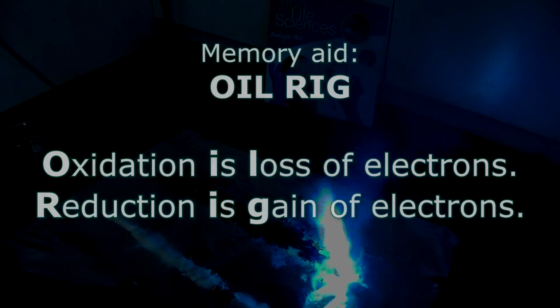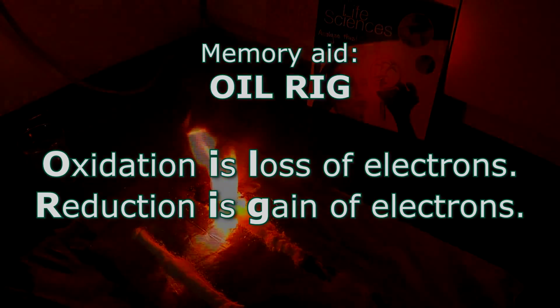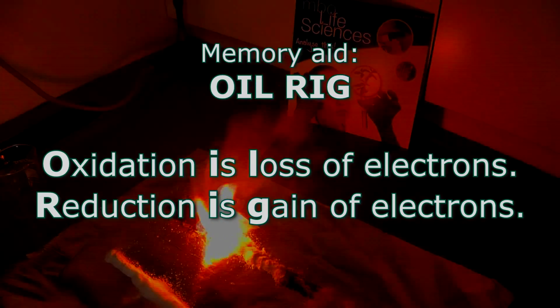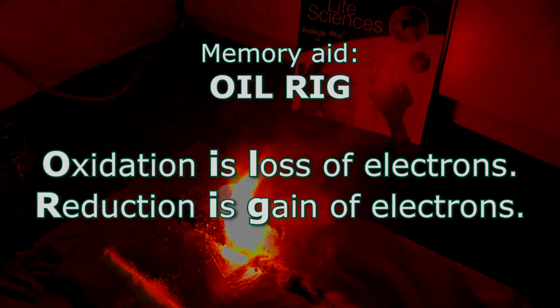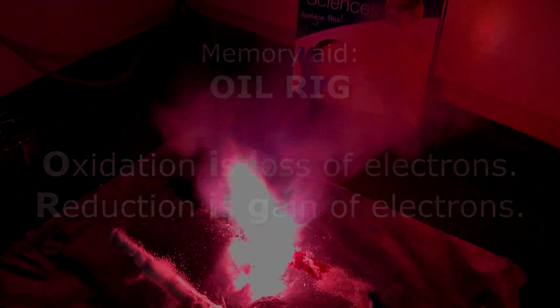One way of easily remembering which is the electron donor and which one is the electron acceptor is by using the following English memory aid. The memory aid is OIL RIG, which stands for oxidation is loss of electrons and reduction is gain of electrons. Now, if you were to take a regular scoop of table sugar and ignite it, then you would not see quite such an intense flame reaction as we have here. The sugar will probably melt and you might be able to see a tiny bit of a flame, but nothing quite as extreme as this.